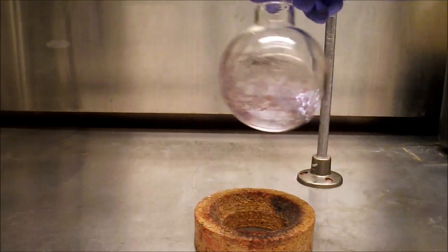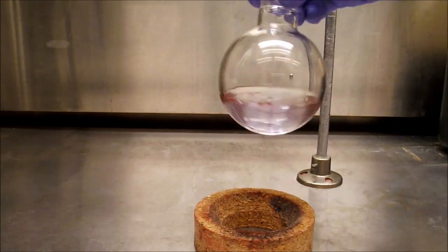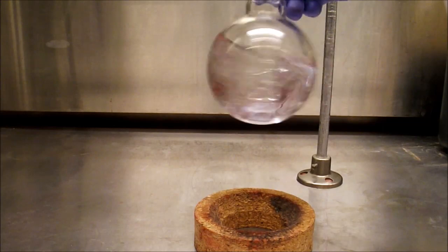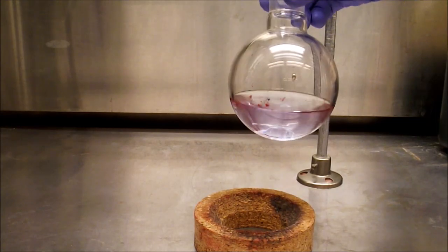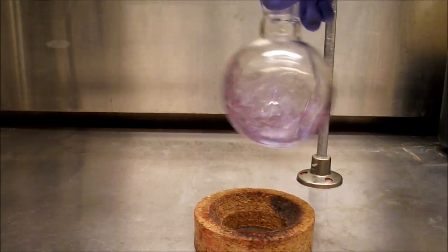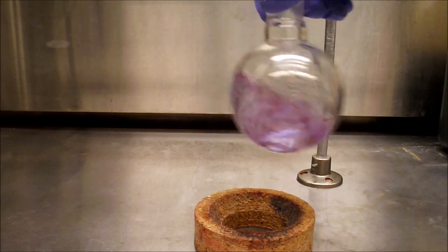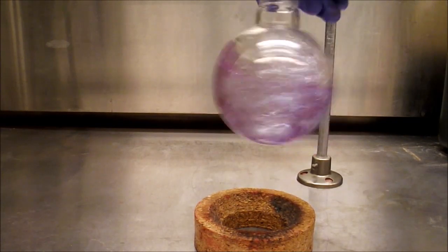Hello and welcome to WelchLab Chemistry. Today we will be utilizing a reductive cyclization or Cadogan cyclization to form an N-annulated PDI monomer. For full synthetic details please see the paper linked in the video description.